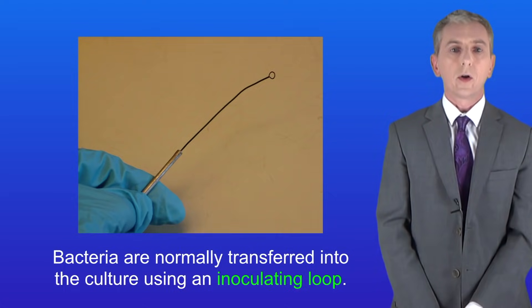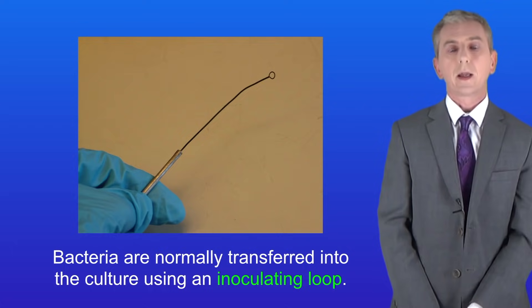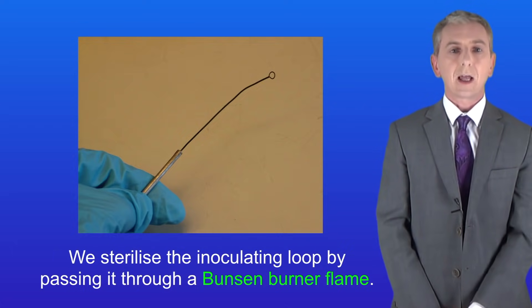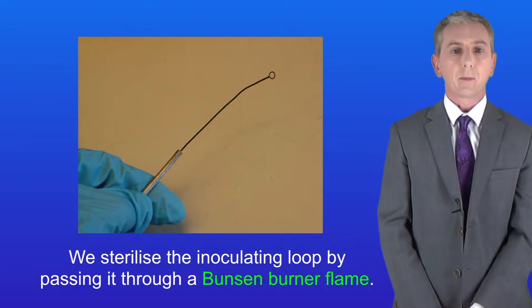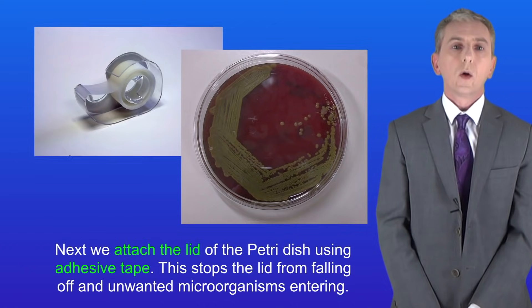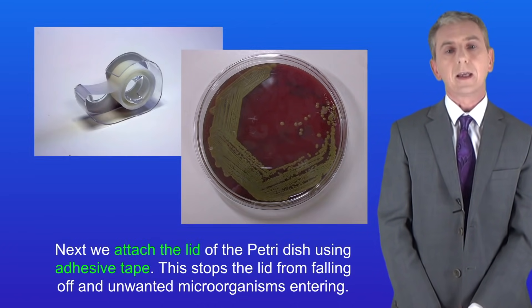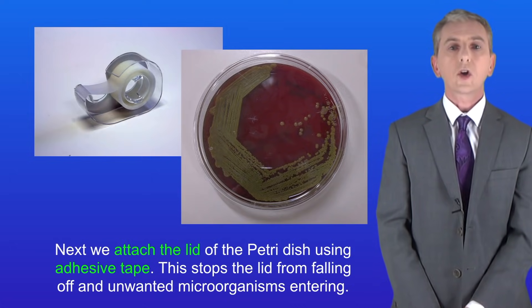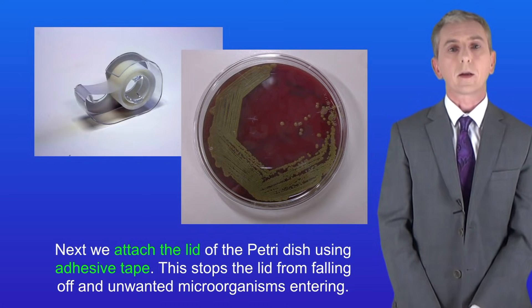Bacteria are normally transferred into the culture using an inoculating loop like this one. We need to sterilize the inoculating loop before using it — to do that we pass it through a flame, for example of a Bunsen burner. Once we've transferred bacteria onto the dish we then attach the lid using adhesive tape. This stops the lid from falling off and any unwanted microorganisms from entering.